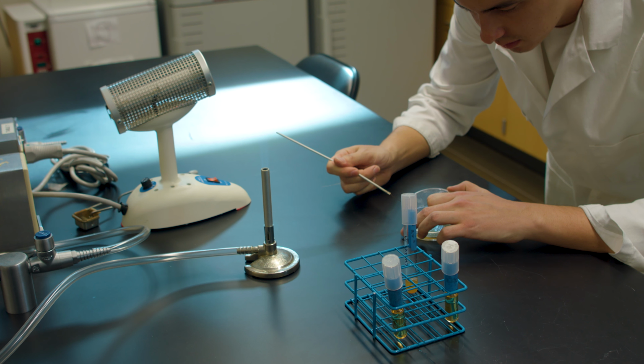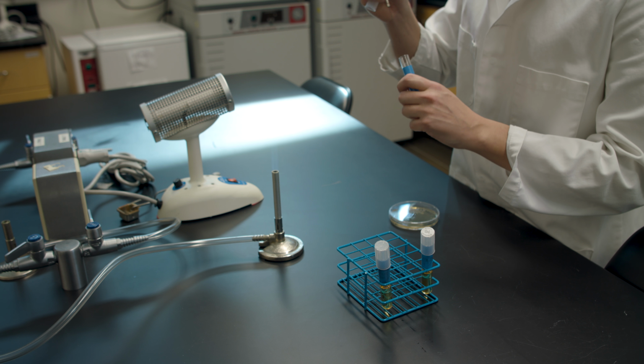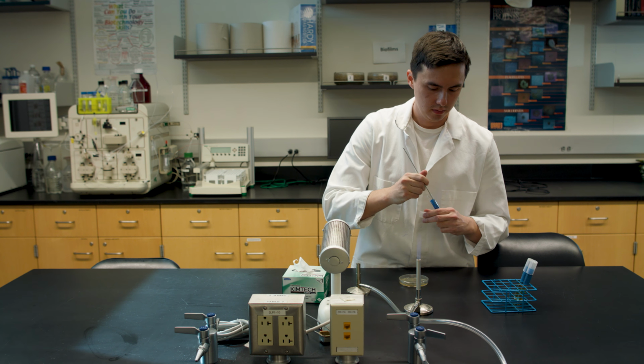The next inoculation presented will be between an organism in a test tube and a sterile broth in a test tube. As before, the test tube tips must be run through the Bunsen burner flame before and after inoculation to prevent contamination. The specimen tube you are transferring from must also be flame sterilized.